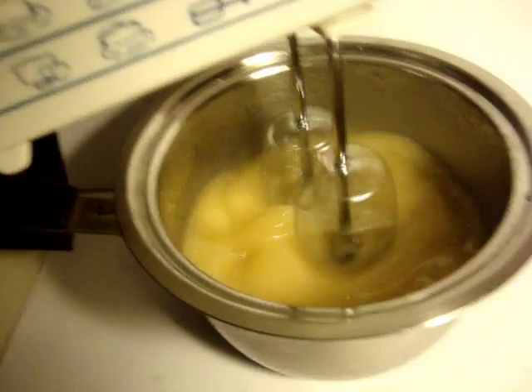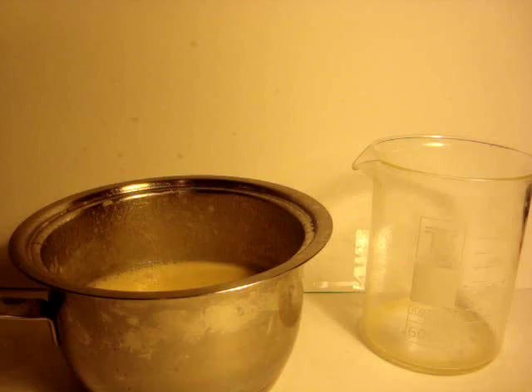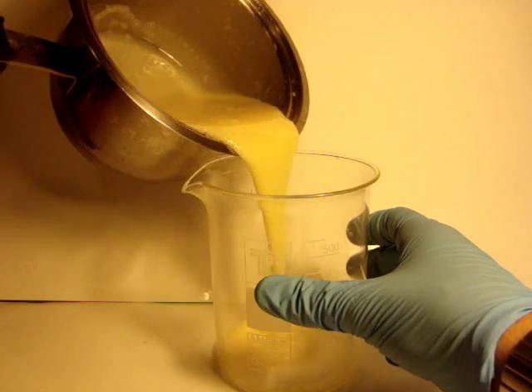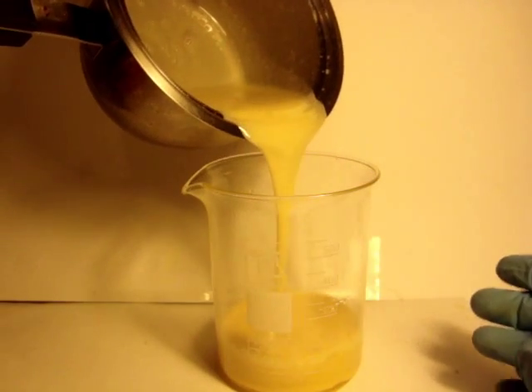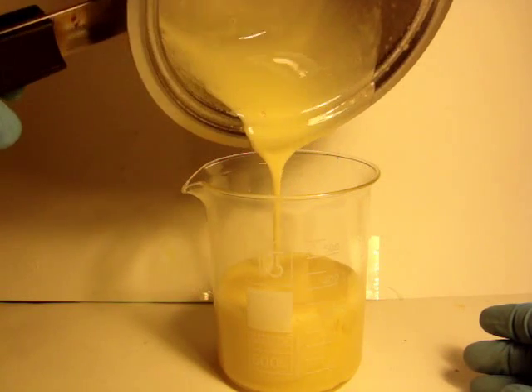Now you have to stir for about 20 minutes, and at the end you will get a yellow paste, a little bit dense. Transfer everything to a mold. You can add a perfumed oil to scent your soap — I'm adding, for example, orange oil — but this is optional.